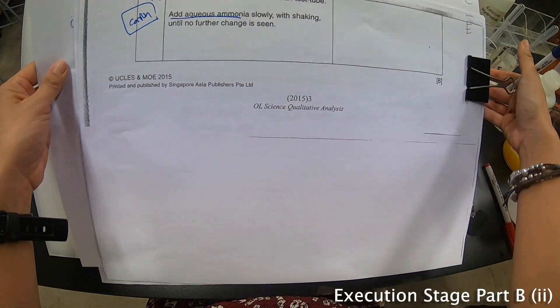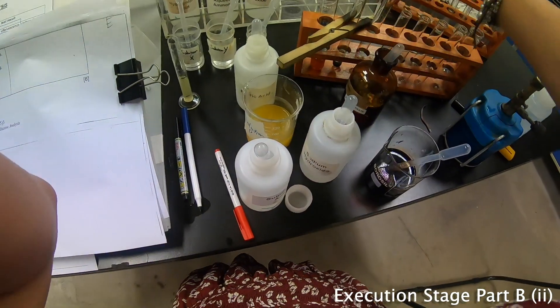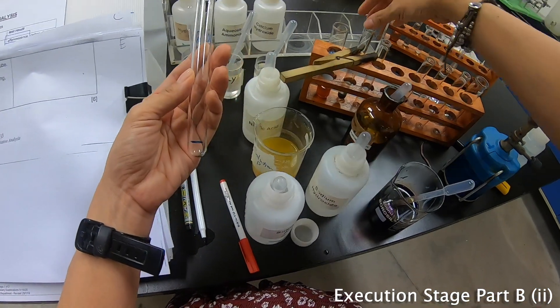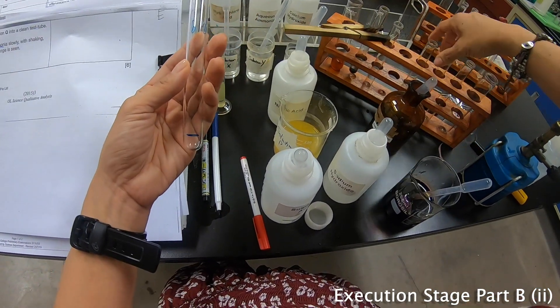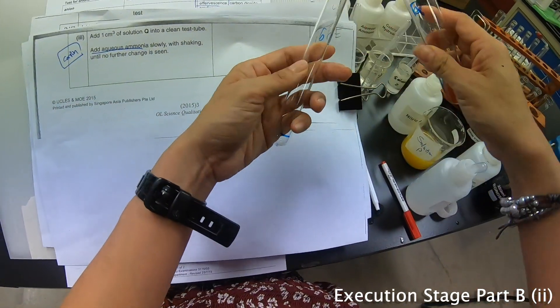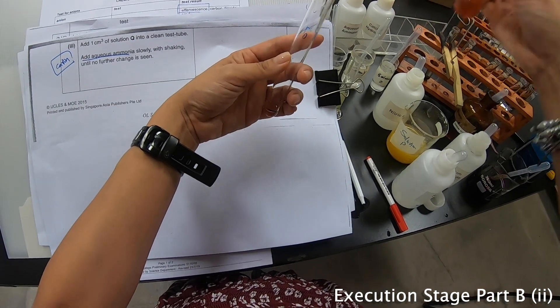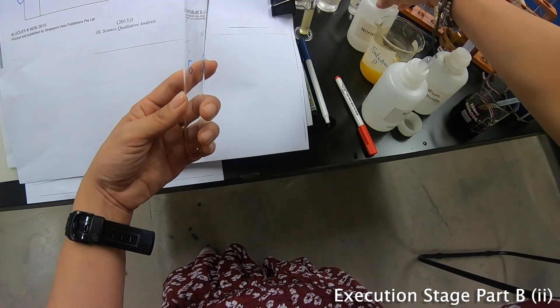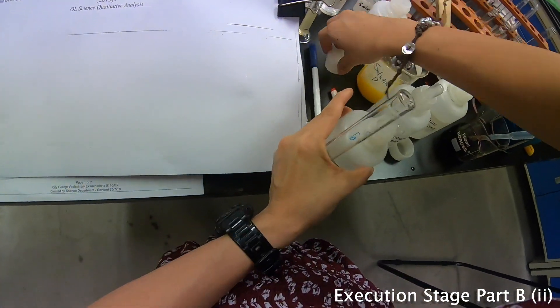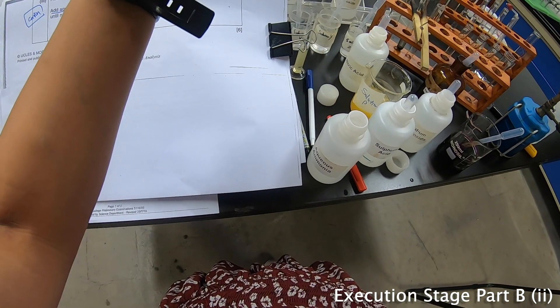I'm ready to write this part down. Now this is the Q that I need to take out for the next test. Let me pour out some of the pale pink solution. They say to add aqueous ammonia — so let me find my aqueous ammonia. Here it is. Add slowly with shaking.